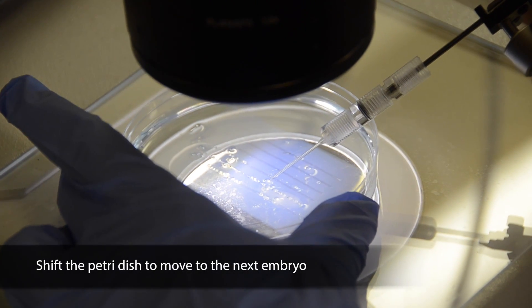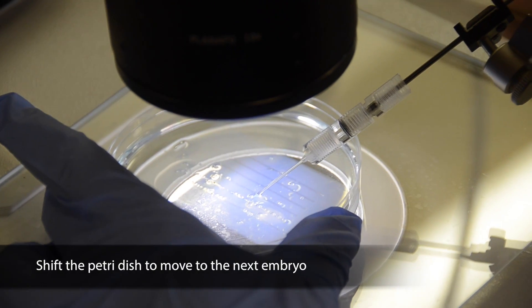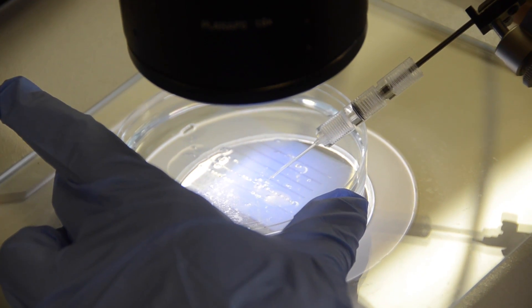When moving to the next embryo, move the petri dish rather than the needle. This will allow you to inject many embryos at a rapid pace.